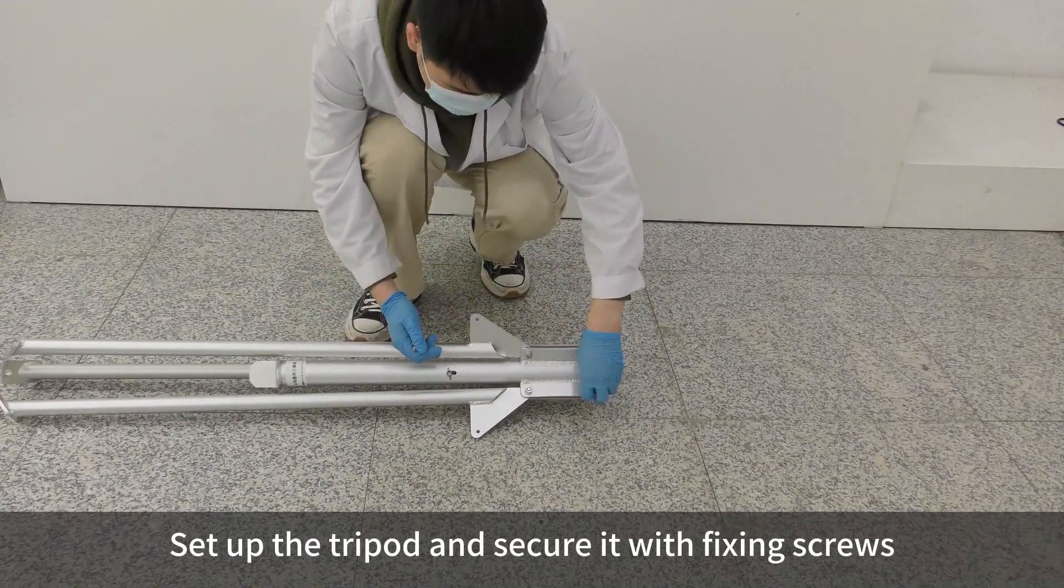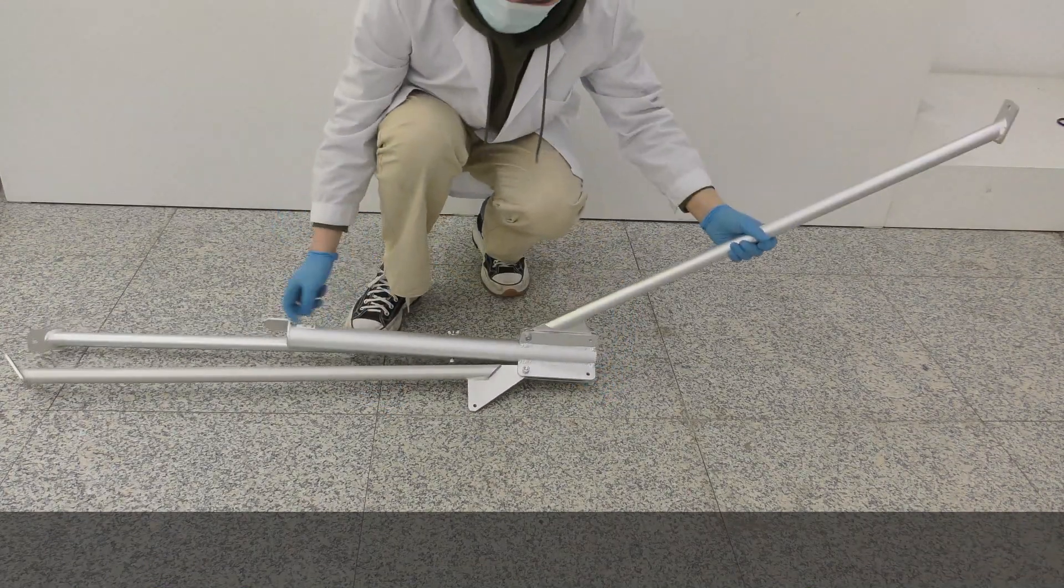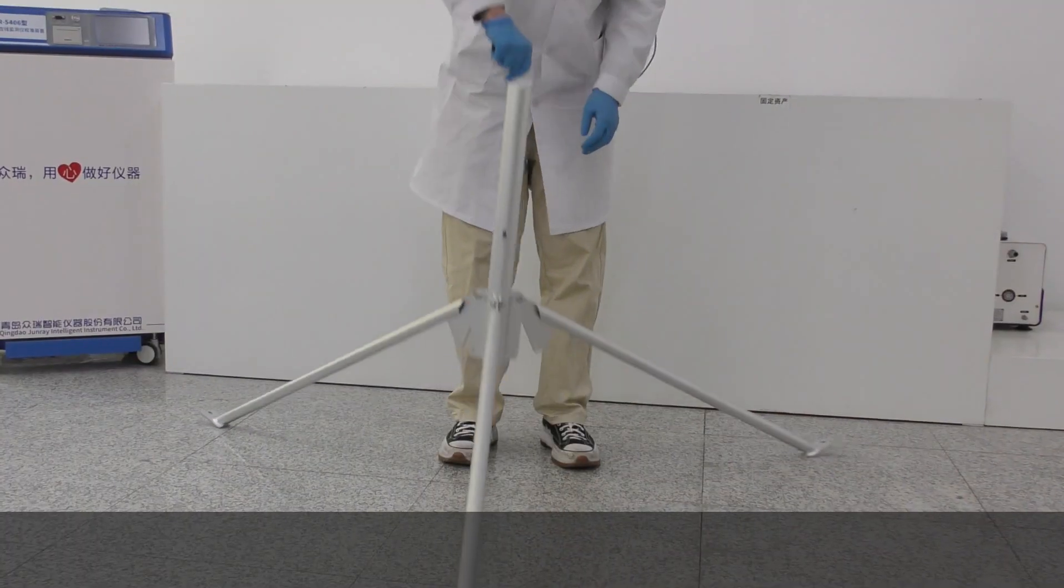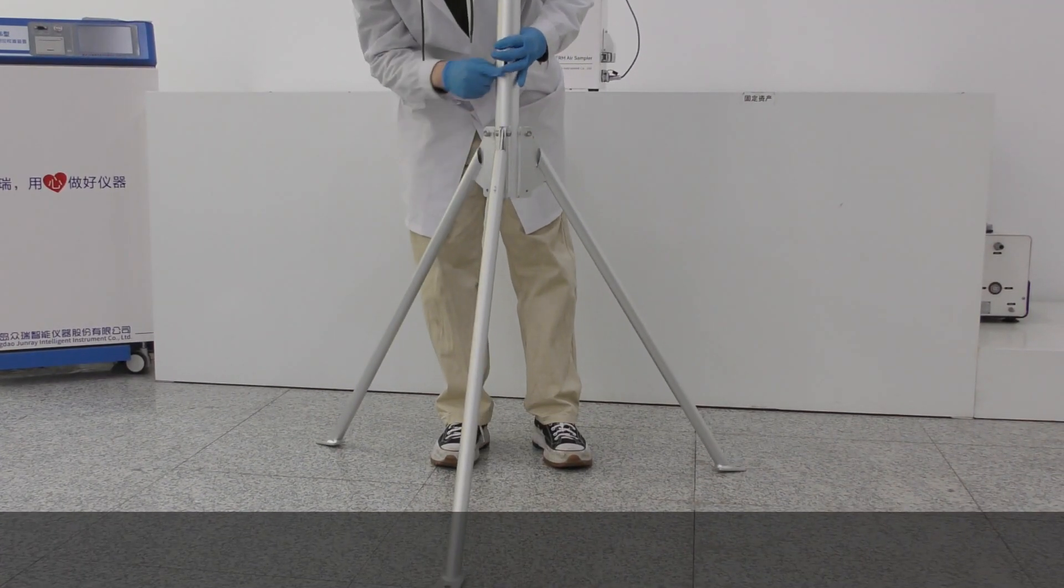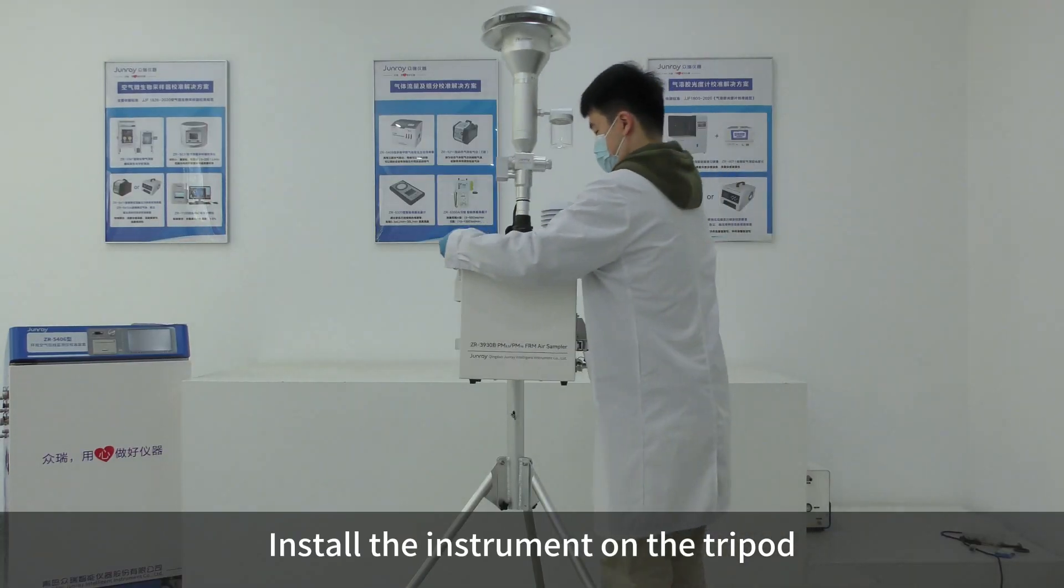Set up the tripod and secure it with fixing screws. Install the instrument on the tripod.